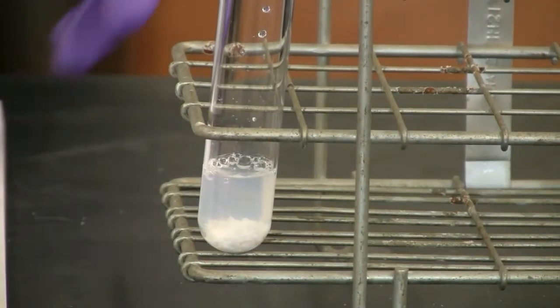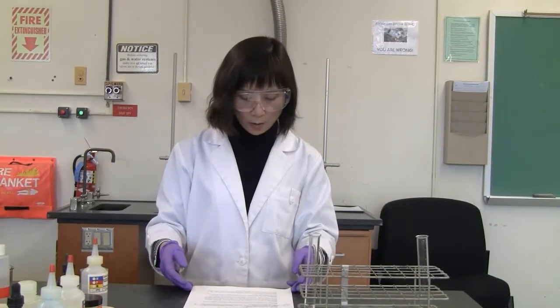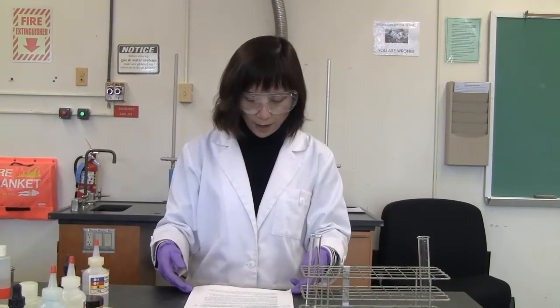Okay. So that's reaction 4. Okay, I think we can continue. Now, let's do reaction 5.